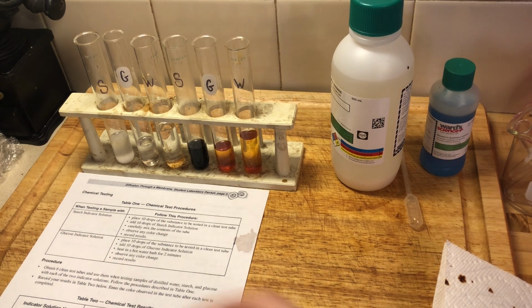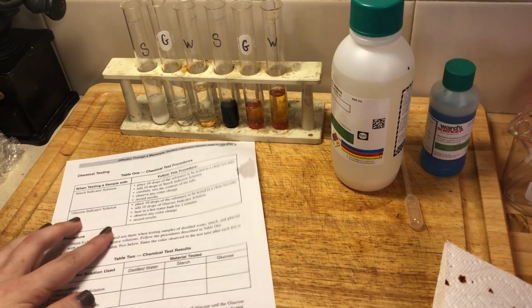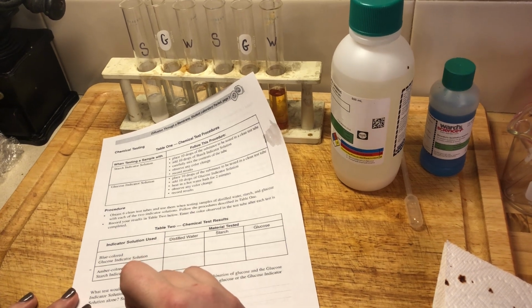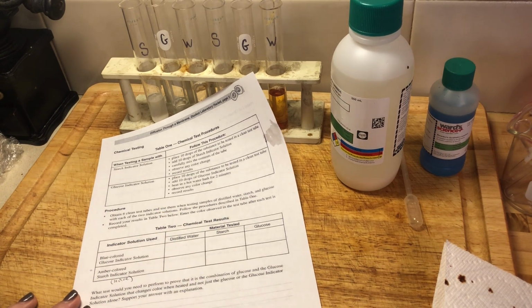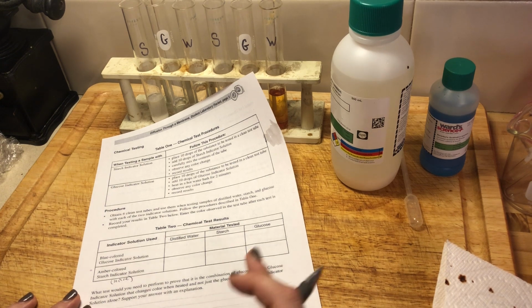And that is how we know that there is starch present in a solution. So we're going to go down here. I'm going to move this back for a second here. We're going to go down here to our chart. And we started with our amber colored starch solution. You can also put in here parentheses iodine, right? Because there's lots of names for these things. I want you guys to make sure that you understand that they all mean the same thing.